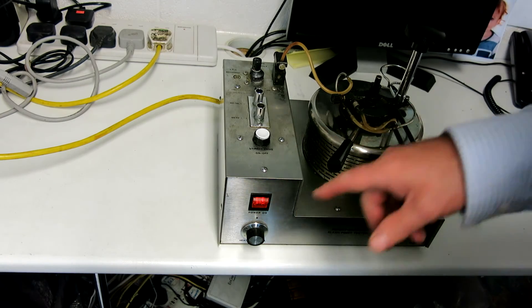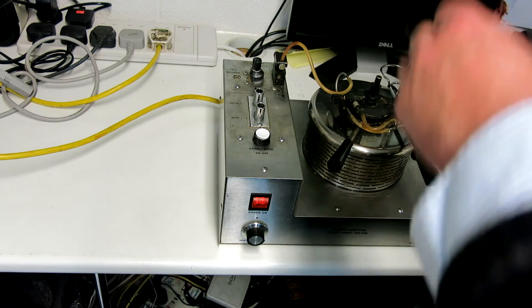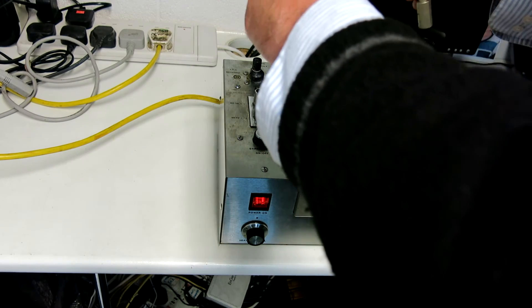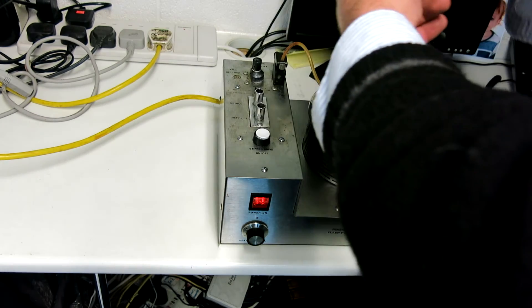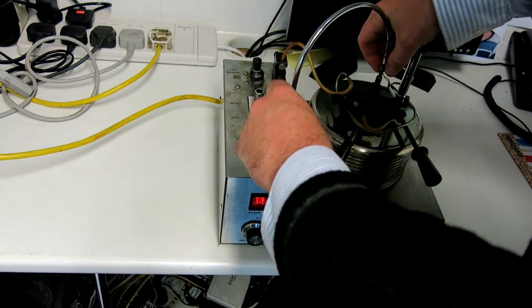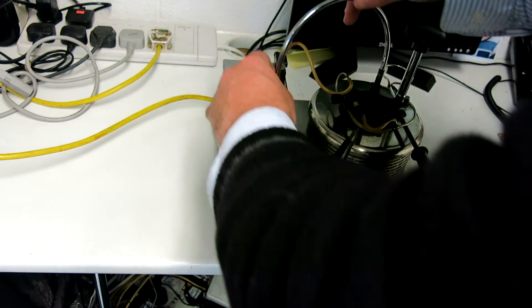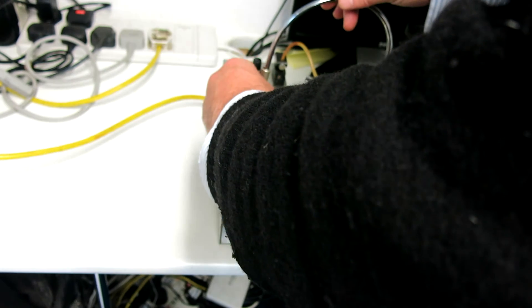So hopefully that gives you some sort of an insight into the instrument. So I'll just put this back on here. That fits into that there. And this goes on to here like this.